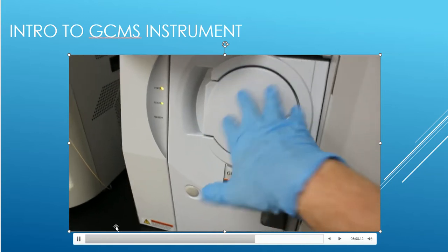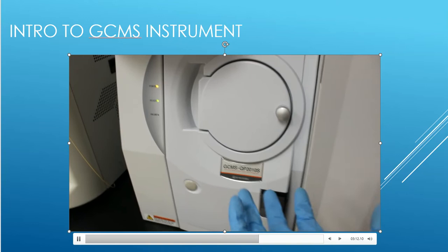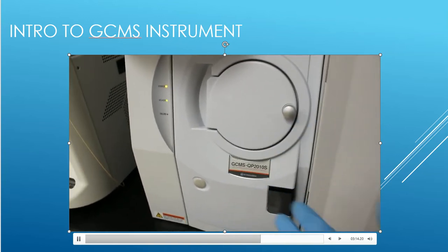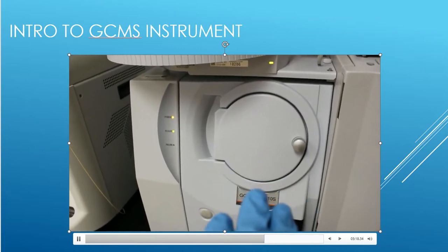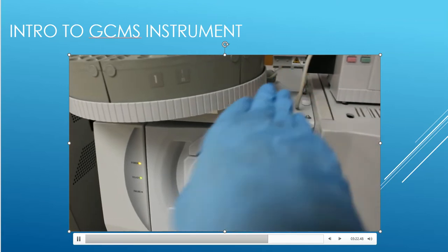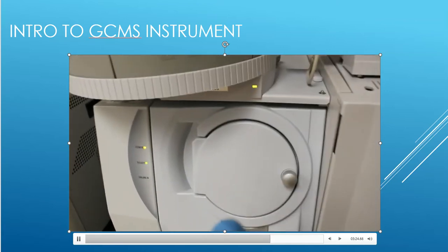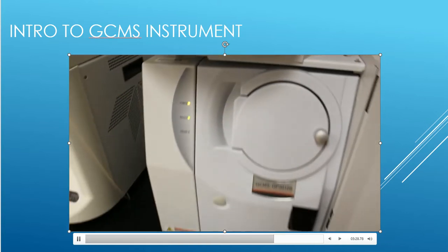In the mass spec, that's where the fragmentation is happening, where the compounds are breaking up into fragments, pieces and parts. That's where the teeth are getting knocked out for the molecules. And then down the quadrupole it goes. The quadrupole is actually lined up this way in the machine. So the compounds zoom down the tunnel, around the bend, and they hit the detector on the back end.